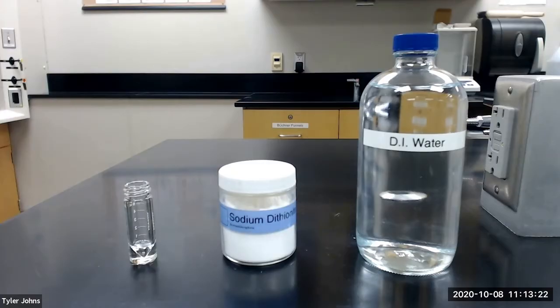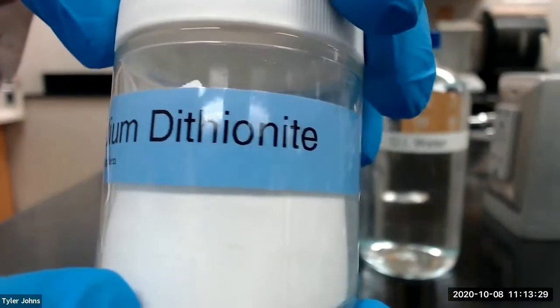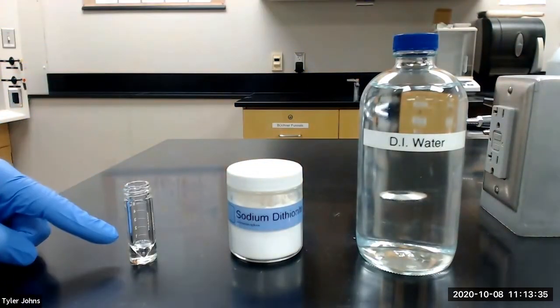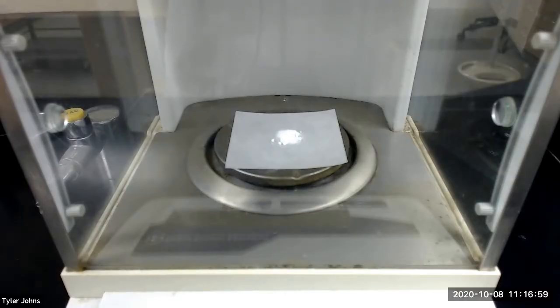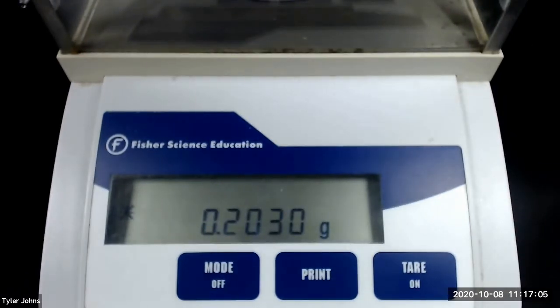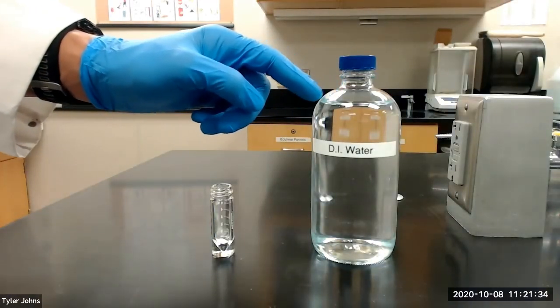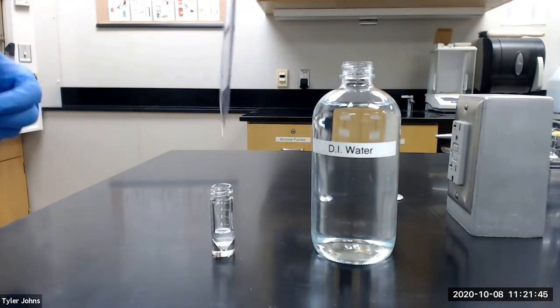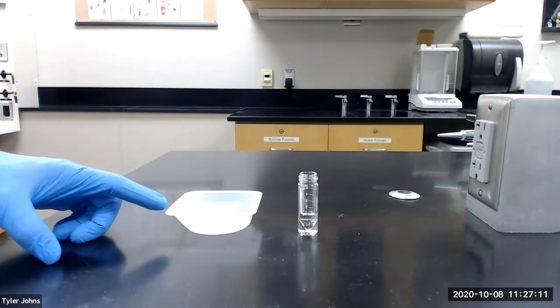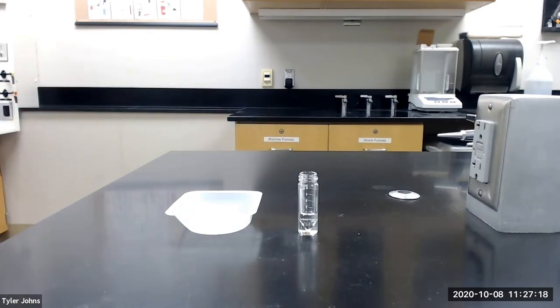We are next going to decolorize our crude product. To do this, we are going to add 0.2 grams of sodium dithionite and 1.5 milliliters of deionized water to a 5 milliliter conical vial. The mass of sodium dithionite that we will be using is 0.2030 grams. After dissolving the sodium dithionite in water, we will transfer our crude acetaminophen product to the conical vial and heat at 100 degrees Celsius for 15 minutes with occasional stirring.